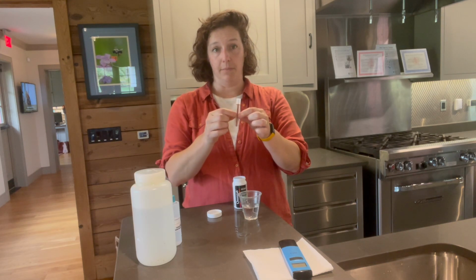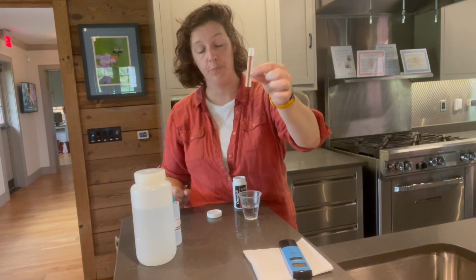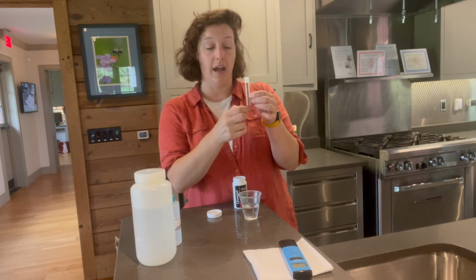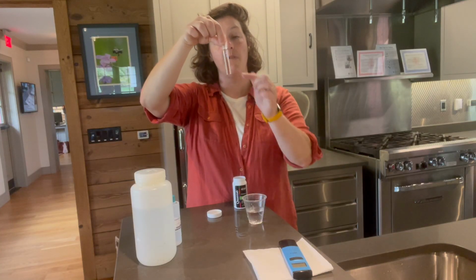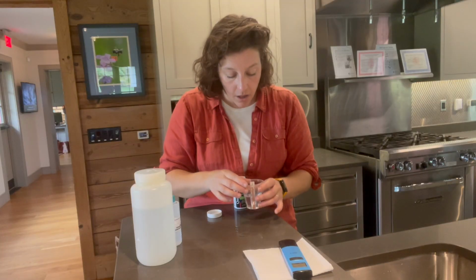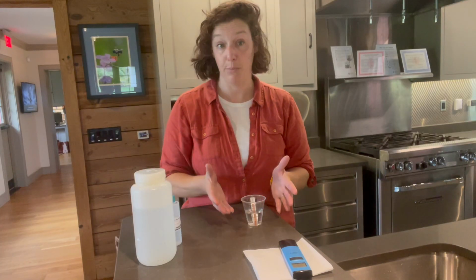Now, there is a top and a bottom to these strips. The top says Quantab, and there's a T-bar that should be orange. We'll know when the sample is done processing because that orange crossbar will turn black. And a yellow peak will form, a little triangle will form on the strip. So when you're putting your strip into your sample, it's very important that the water does not rise above that orange crossbar, or else you'll accidentally trigger it to show that it's been completed before the test is actually finished processing. So we'll take our sample and stick it in, and you can keep an eye on it, but it can take a minute or two for this sample to fully process. So I'll see you in just a second when the sample's done running.